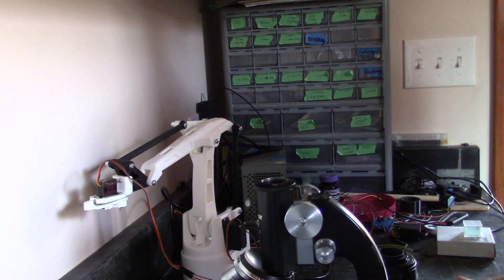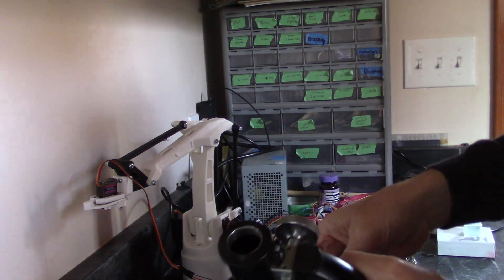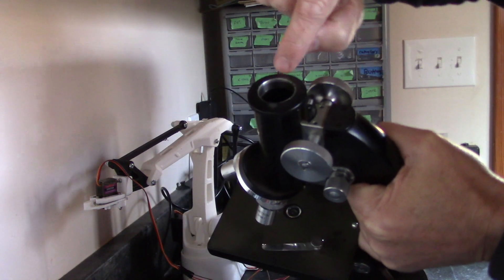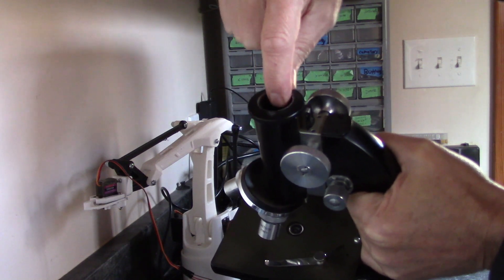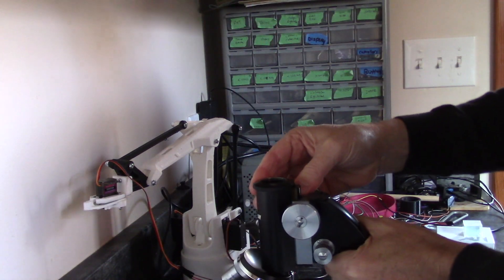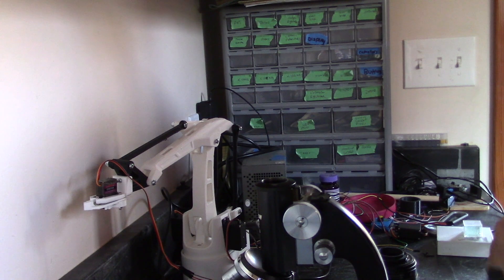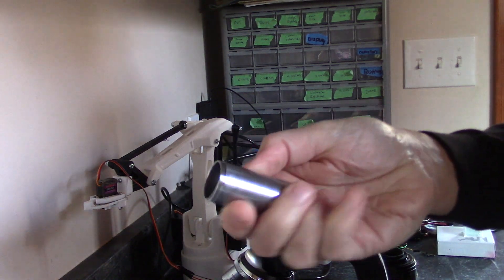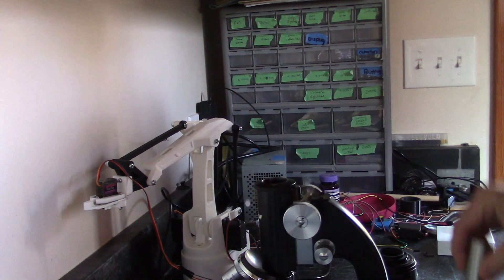So if you look down in here, I've got about approximately one half of an inch of surface. And so a little bit of tape on there, and it only needs to be a couple of wraps because it only needs to be about that thick.